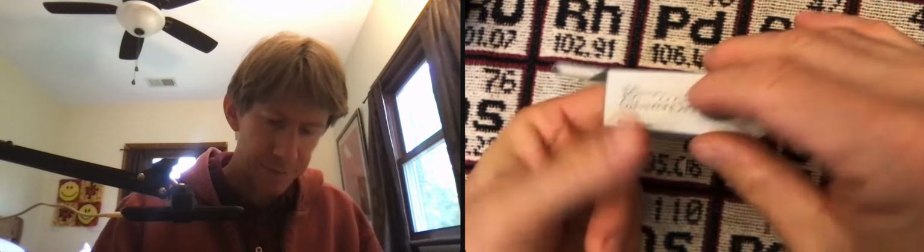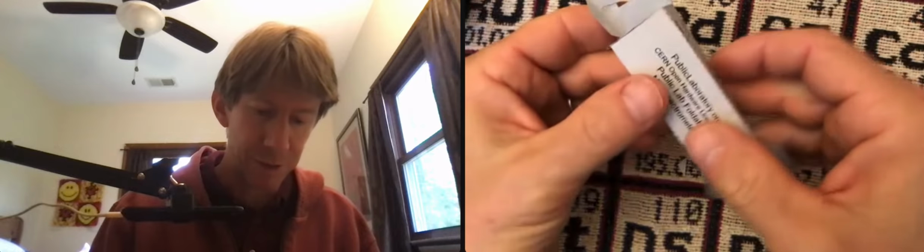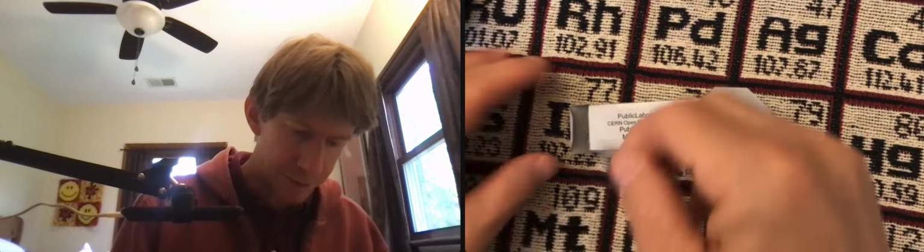And I will tell you, my craft at this is not the best, but more than adequate. That's the level I'm going for here. And let's go ahead and tape this closed too. We'll tape this top one first. And the more structure you can give to it, the better.